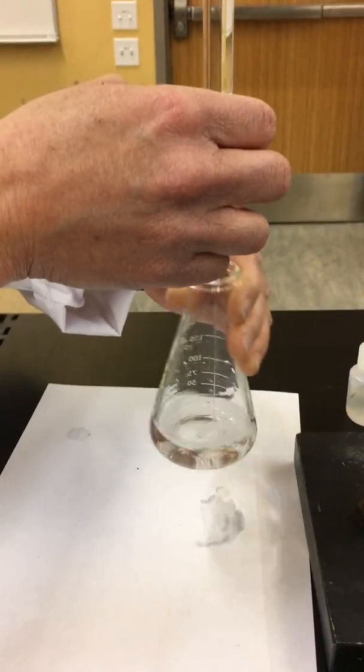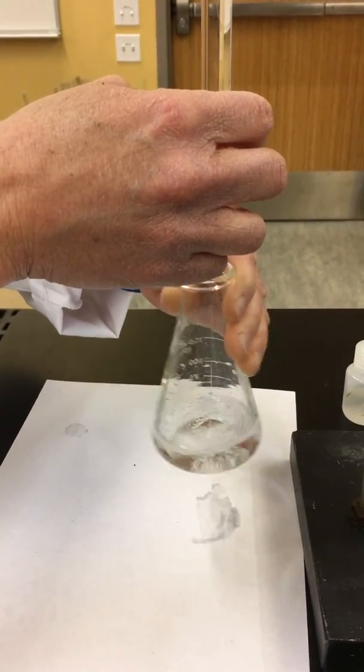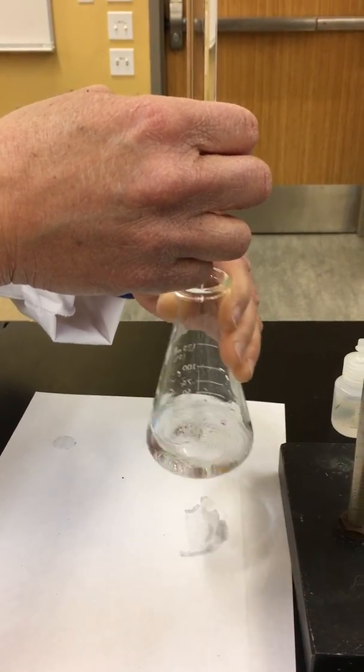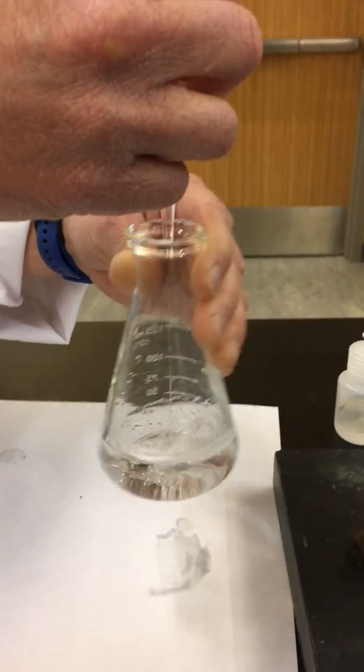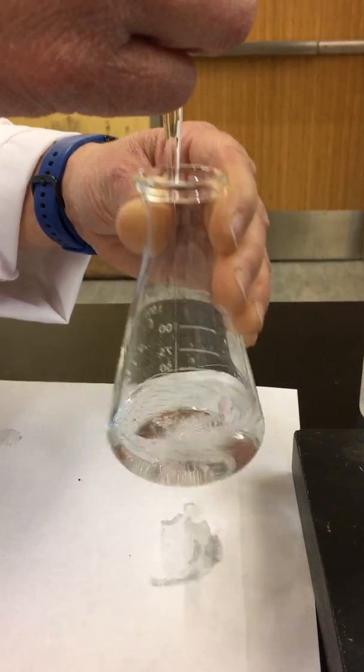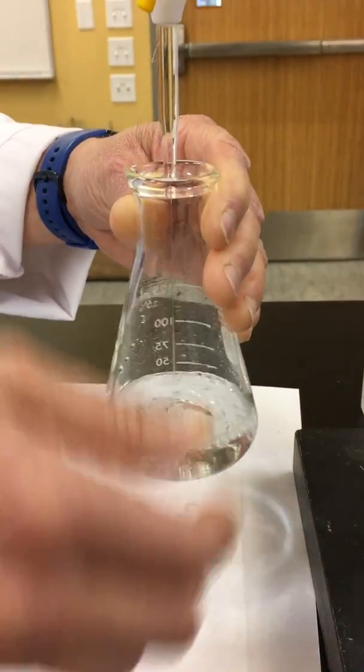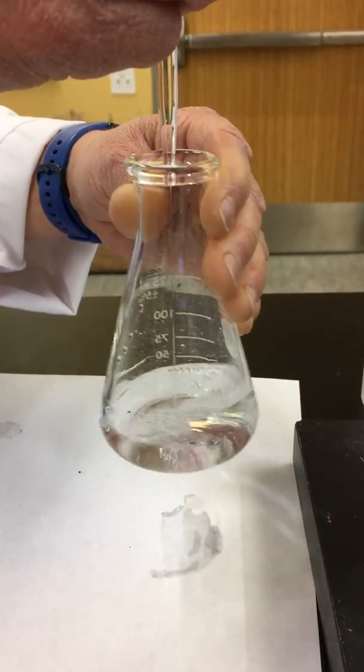So notice again, initially, I'm doing it pretty fast until we start to see that pink color start to form. And if you look, you can see the pink color slowly starting to form.